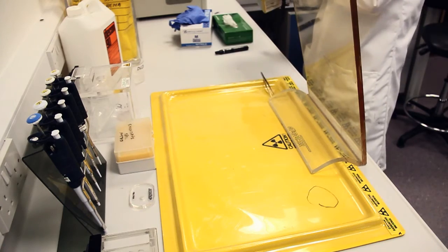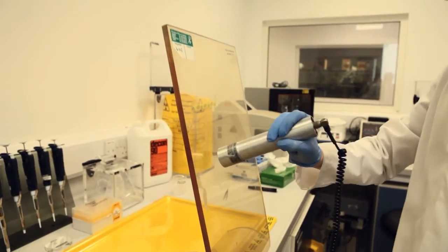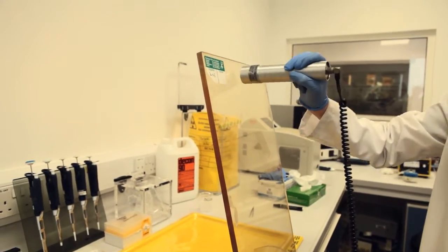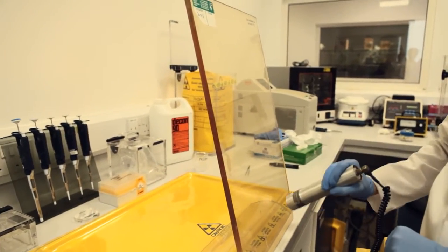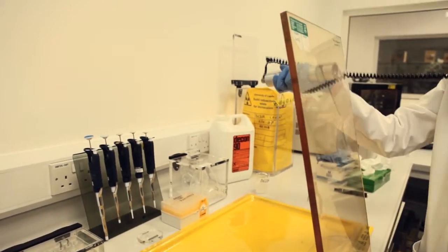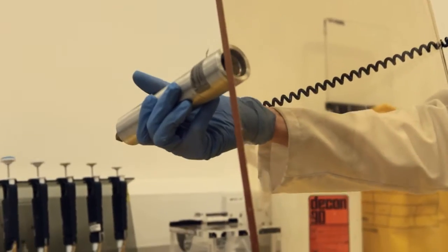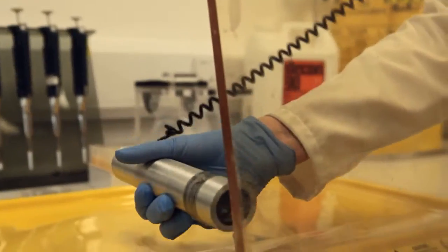He then picks up the monitor and continues to examine the workstation and perspex screen. Once he has completed that, he removes the screen.